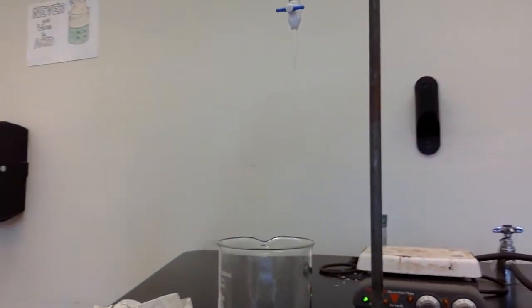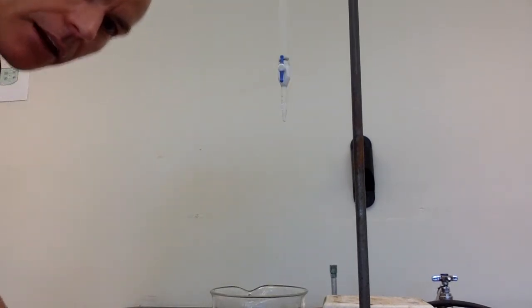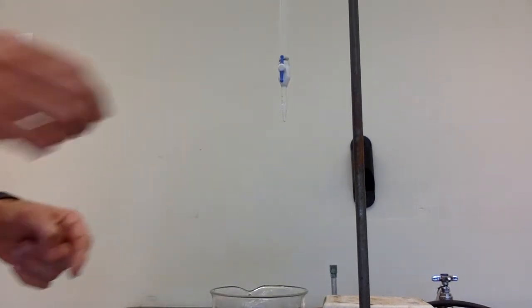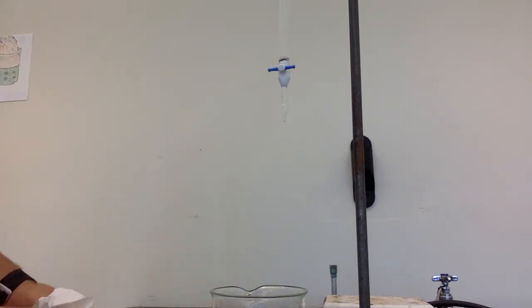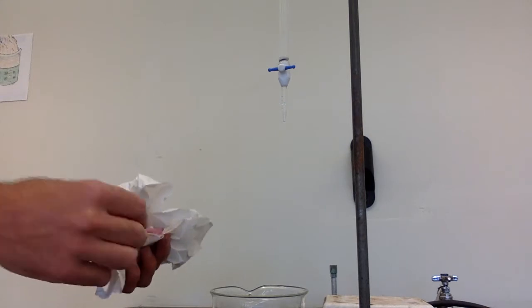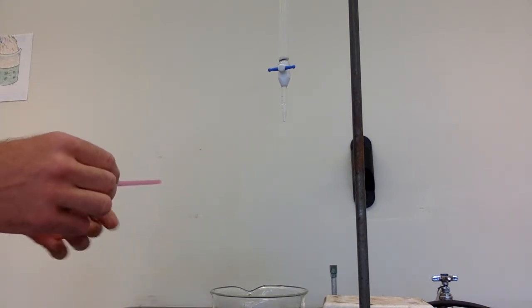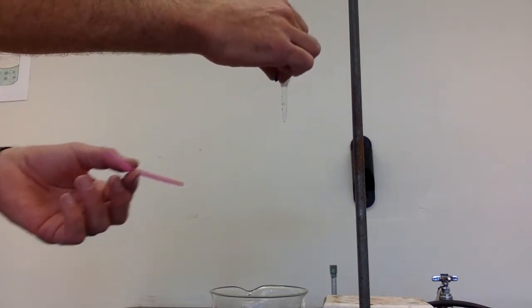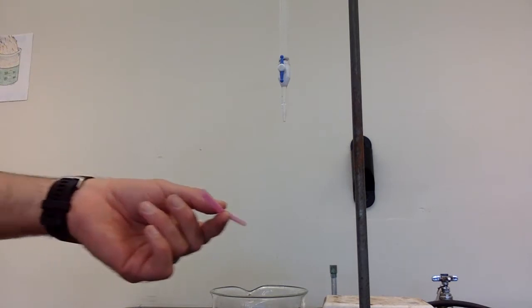So in this activity, you have a burette filled with water, which is right here. So I can turn this, and then it'll be a little hard to see, but there's a stream of water coming down. And then what I'm going to do is take this plastic drinking straw and rub it with a paper towel. I'm going to rub the paper towel across the plastic drinking straw. And then I'm going to let the water flow again, and I'm going to hold the drinking straw near it, and we'll see what happens to the flow of the water.